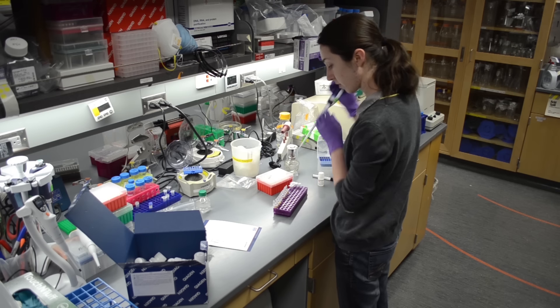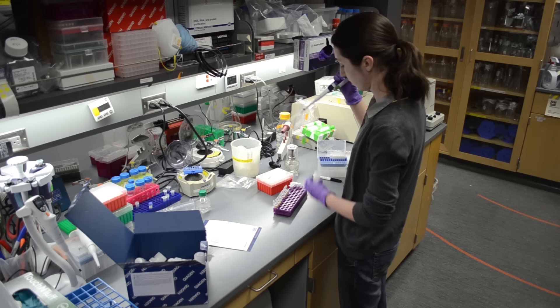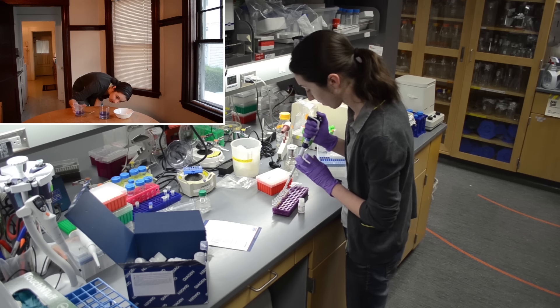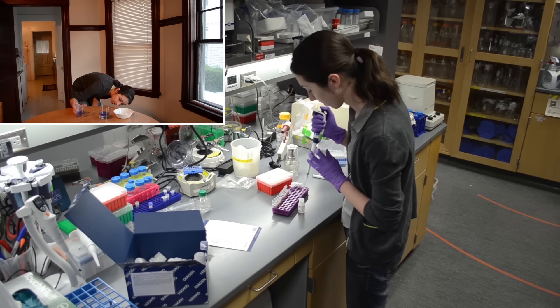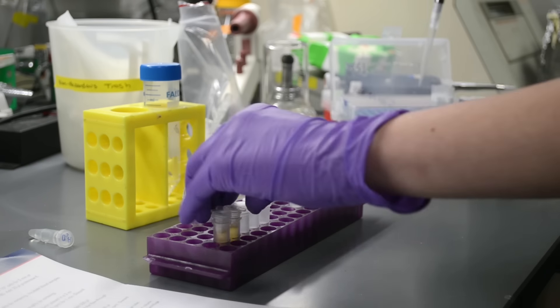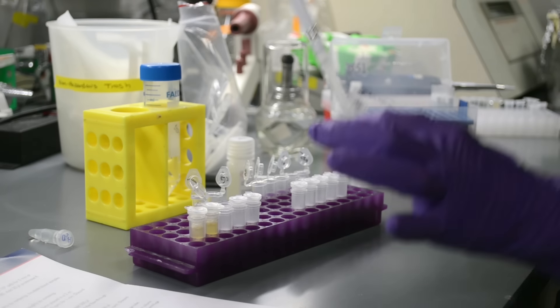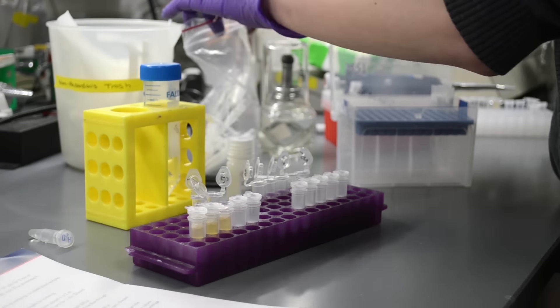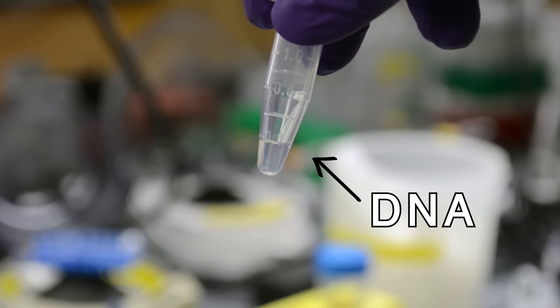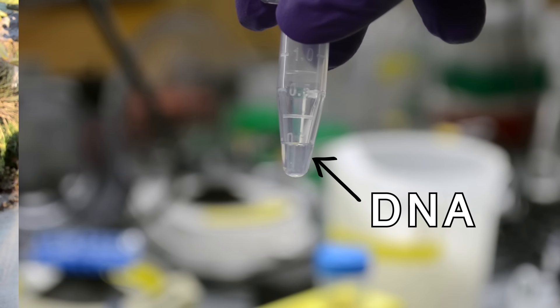Now that we have our fruit samples, we have to extract their DNA. You may have seen strawberry DNA extractions before, or even my own cheek cell extraction many videos ago. The kit I'm using in lab works by a pretty similar principle: break open cells, get DNA, wash DNA. This is just far more standardized and clean.